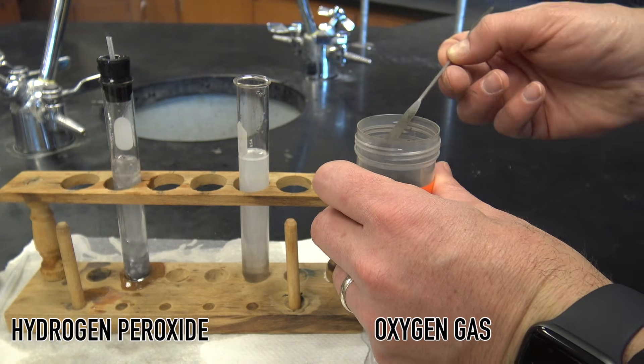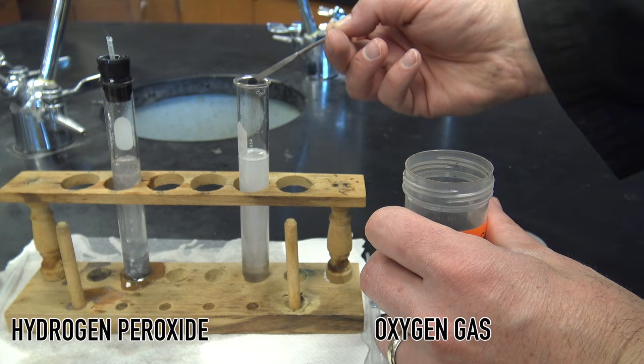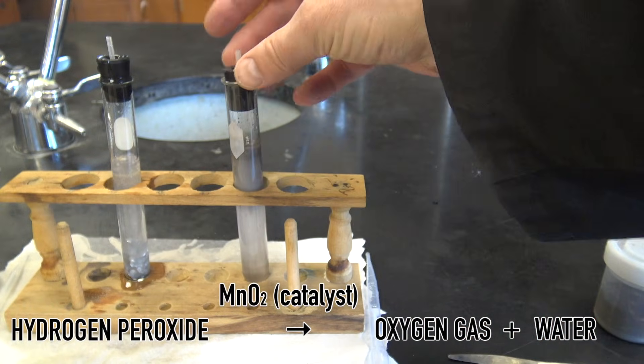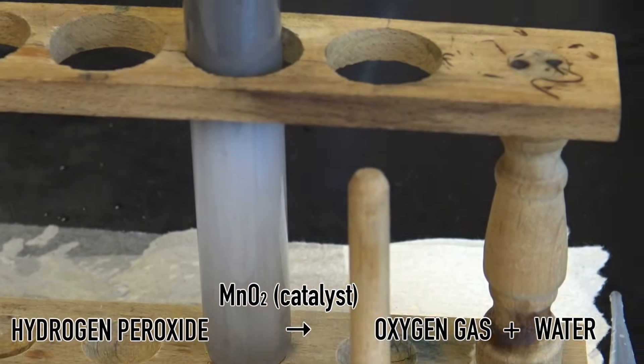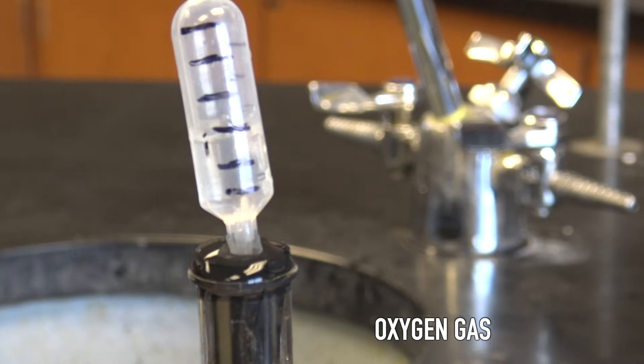There we go. We're going to use a minuscule amount, because we don't want this to decompose all at once, just a very slow decomposition. Remember, this is oxygen gas. We're going to fill it up.